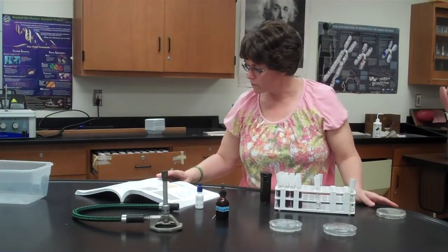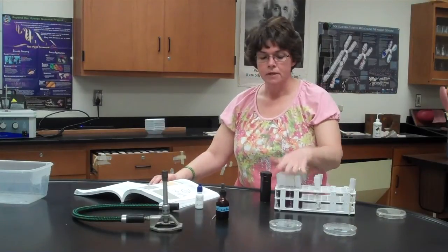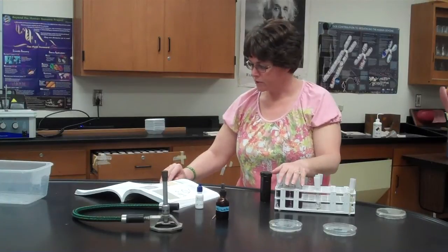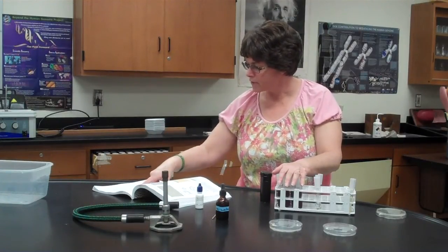And it says for the fermentation tubes that you're going to go for 4 to 5 days. We're going to basically do this all for a week. So we'll start this Tuesday, this week, and then we'll do it 1 week later. We'll look at the results. The plates say to go for 7 days, so since we're doing it all for 7, we'll just keep it consistent.